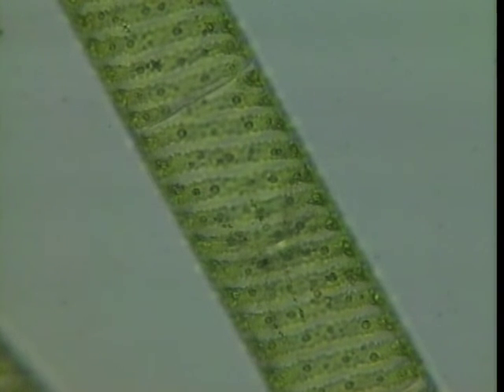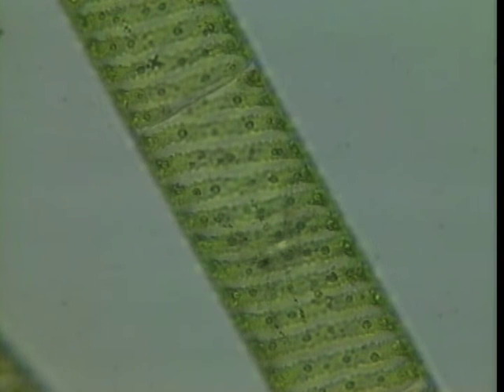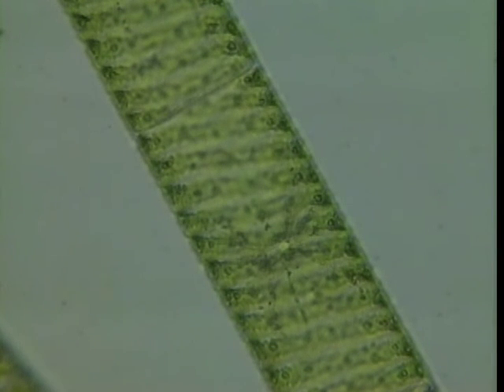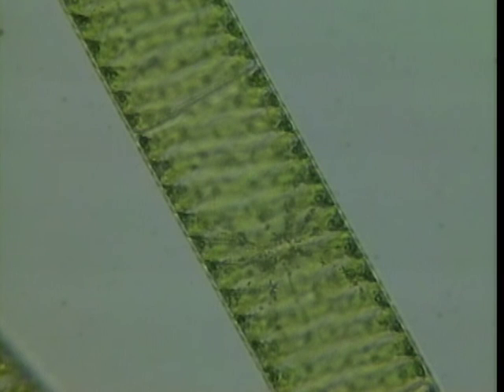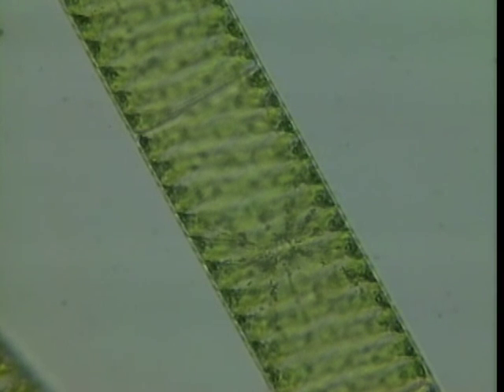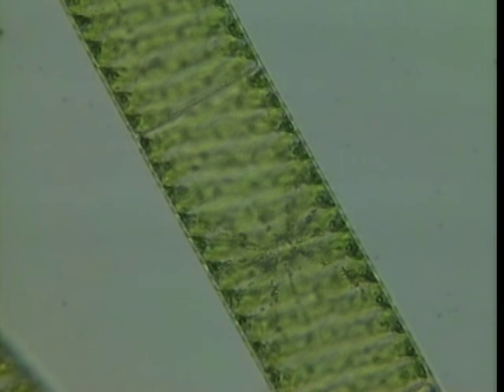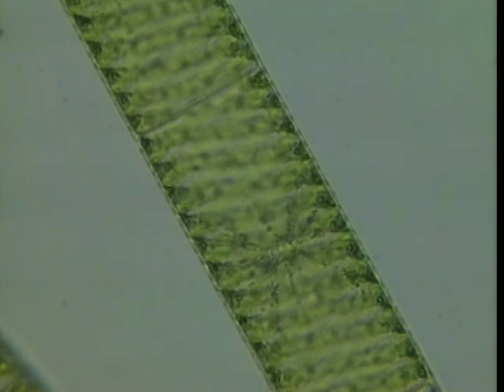So that's another reason why it's studied in botany, because the cells are very distinct, and it's very pretty, and it has a very nice name — Spirogyra. And you can see why it's called that, because it spirals away.